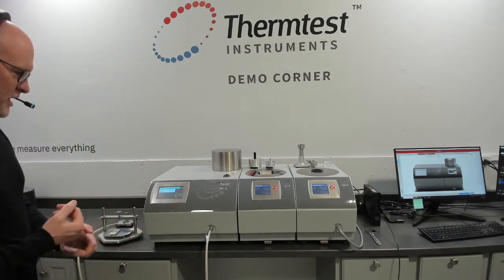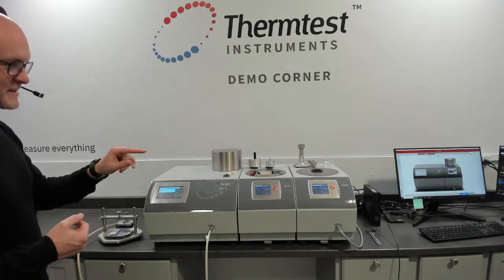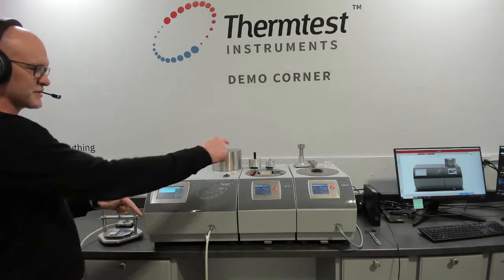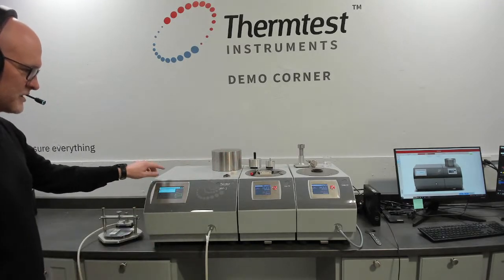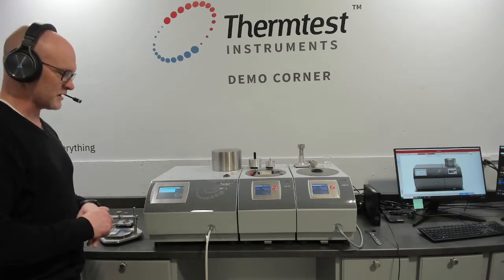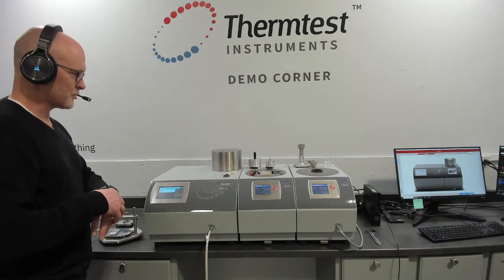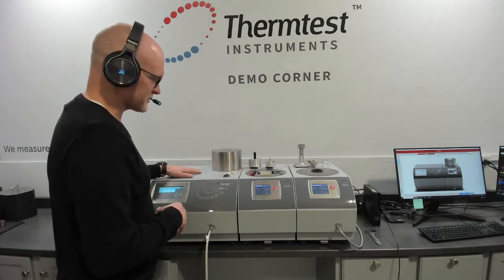So with the smart software, which allows us to schedule everything and take advantage of the transients being short test times and each device needing to control temperature, the 4-channel switch and smart software let us orchestrate all that in a convenient, rapid manner.